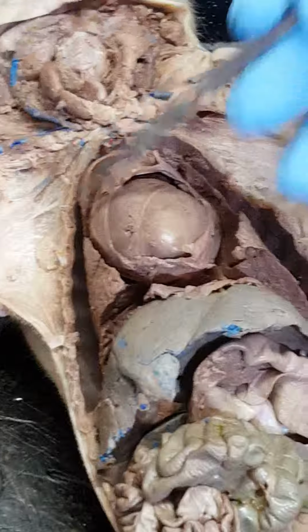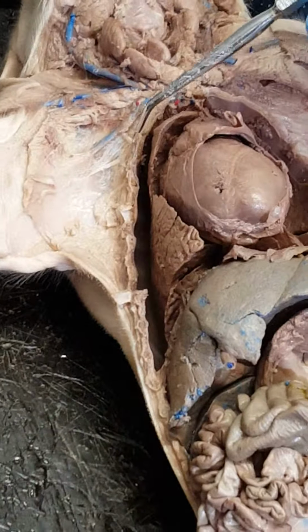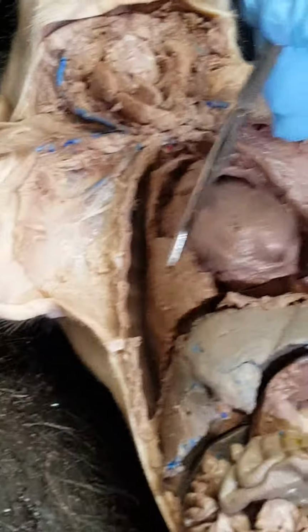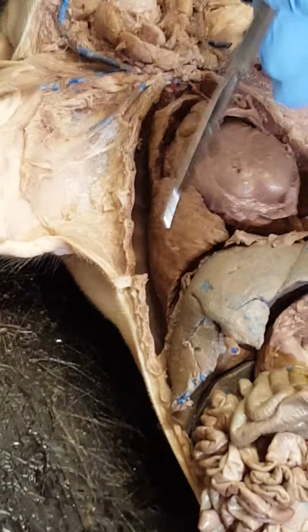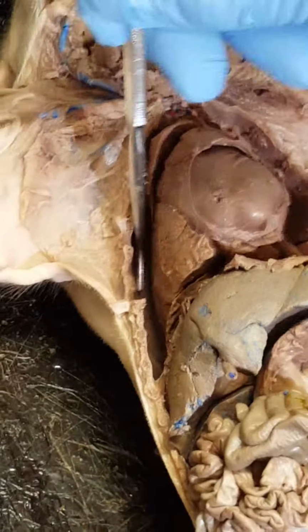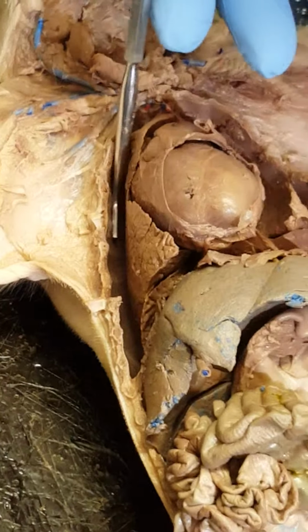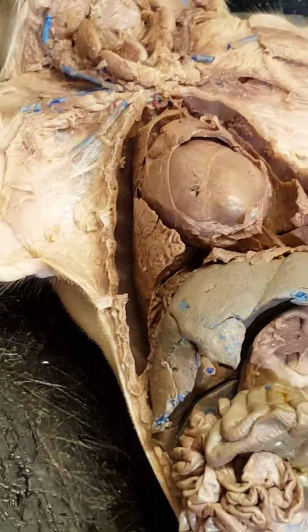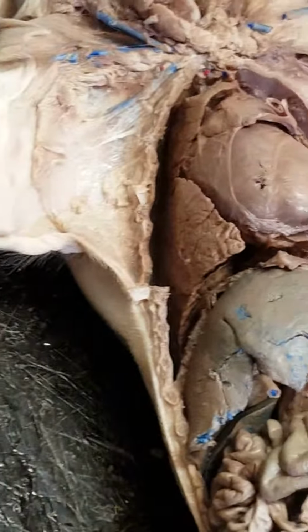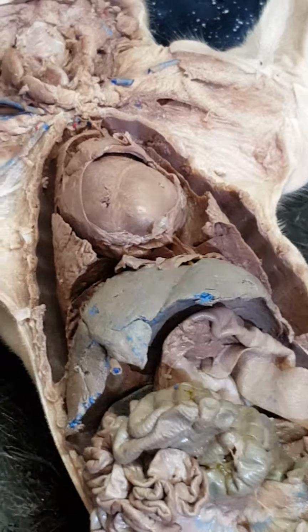Okay, now the same is true for the lungs. In the lungs you have the pleura. The membrane that is in direct contact with the lungs is called the visceral pleura. Now the membrane that lines the rib cage is the parietal pleura. Normally they're very, very close together, and there's a lubricant between them, so that when the chest pulls up, the lungs will inflate and things like that.